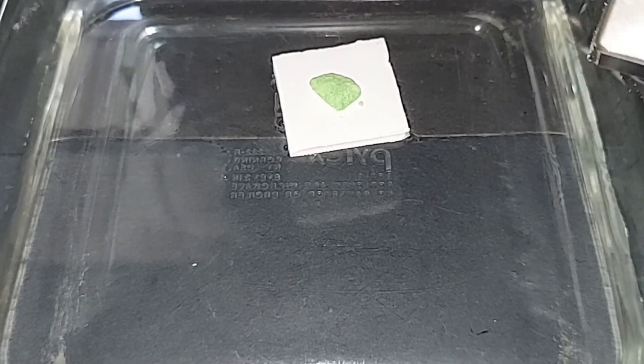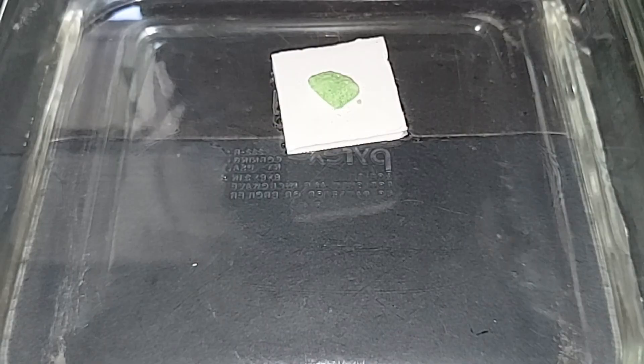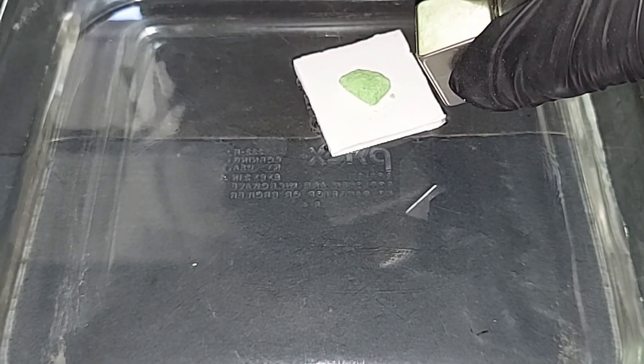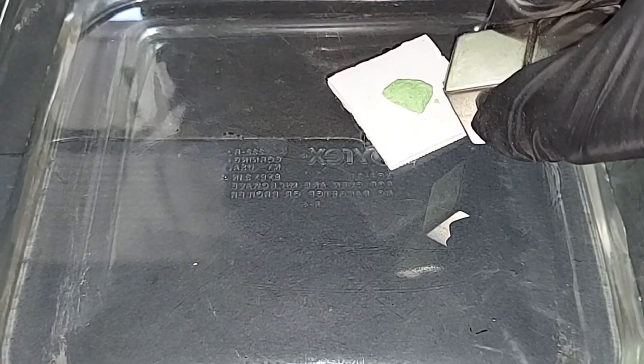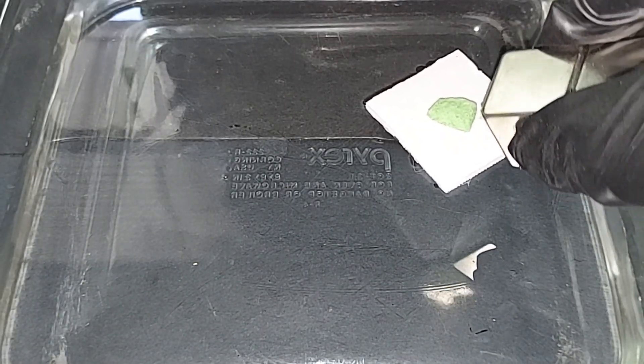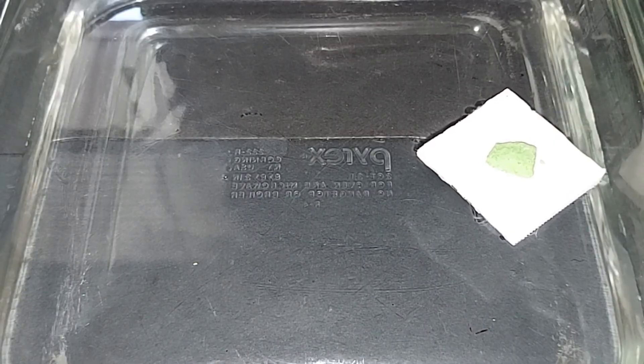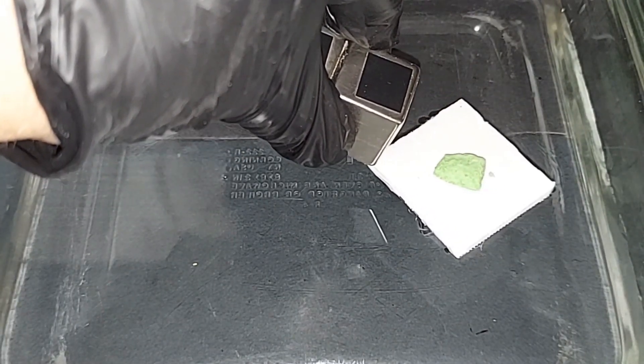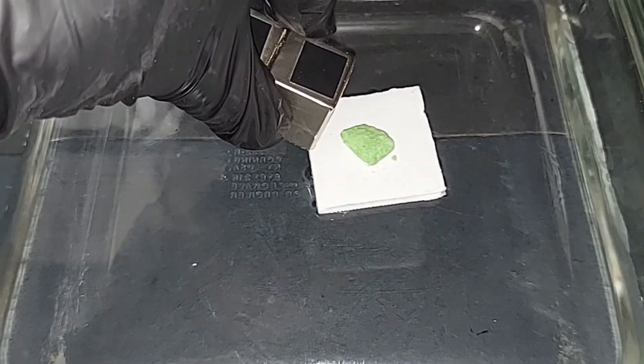And as it draws it closer, you can clearly see that I can drag it around the water. And we'll do it the other direction.